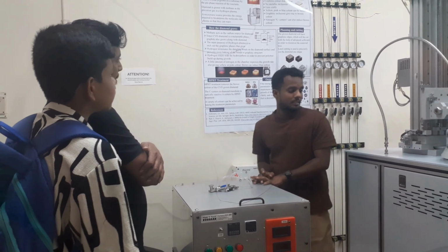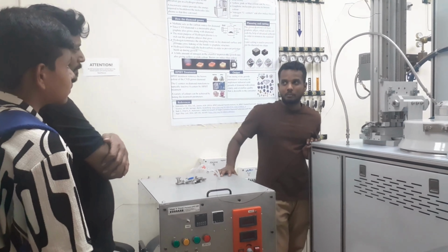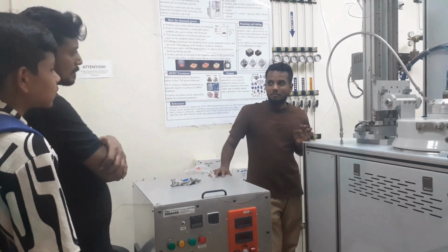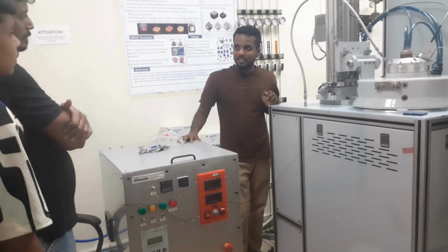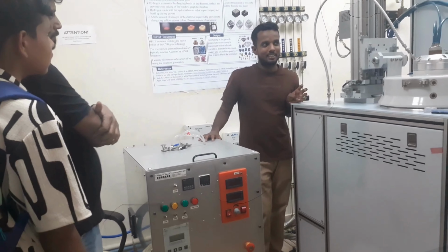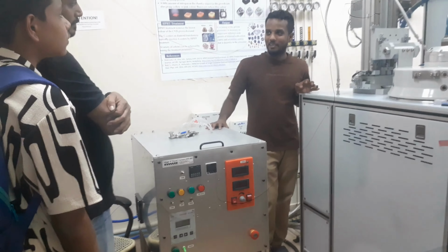So this is MPCVD, the MPCVD instrument. CVD, I think everybody knows: chemical vapor deposition. It is a common term. The prefix does matter. There are many CVDs: MPCVD, HFCVD, MOCVD. Based on the prefix, it will do different work.